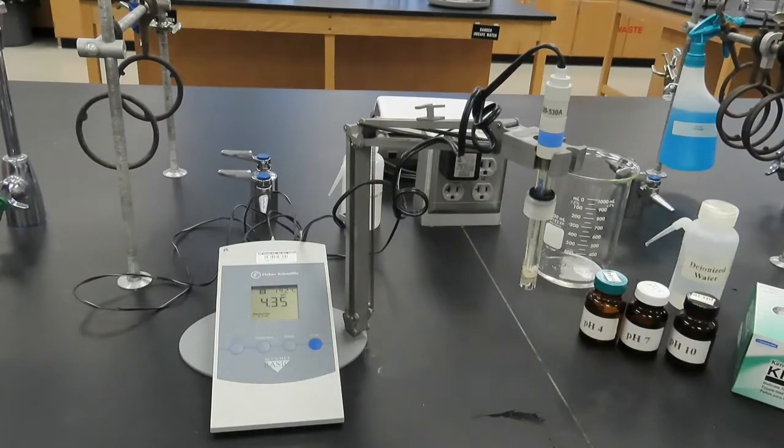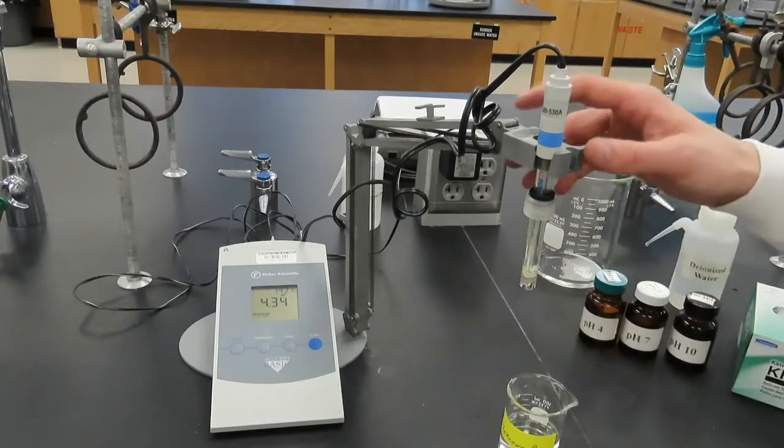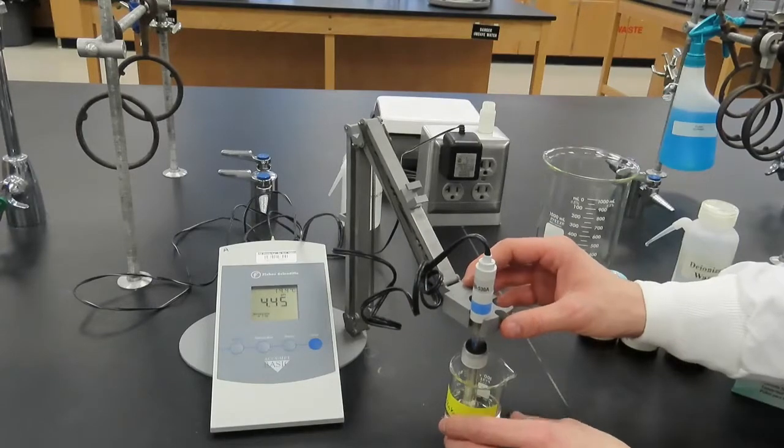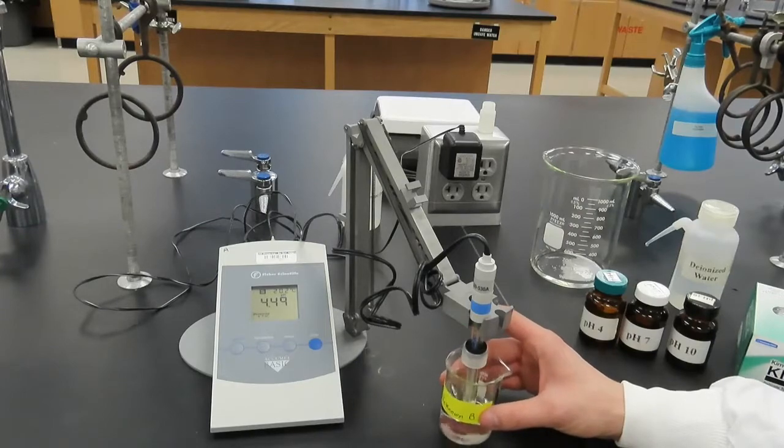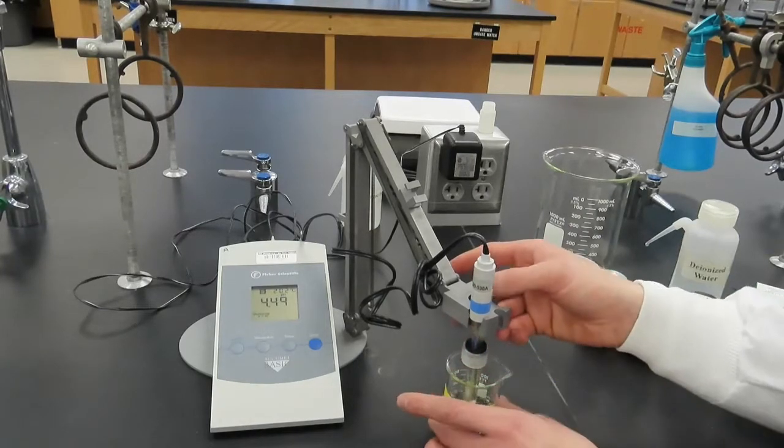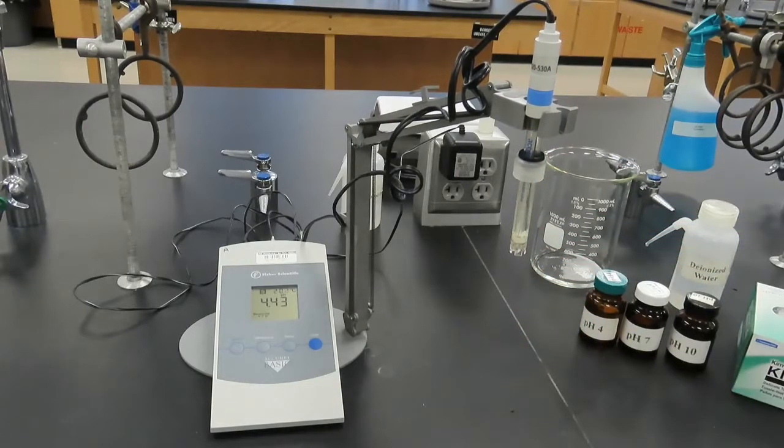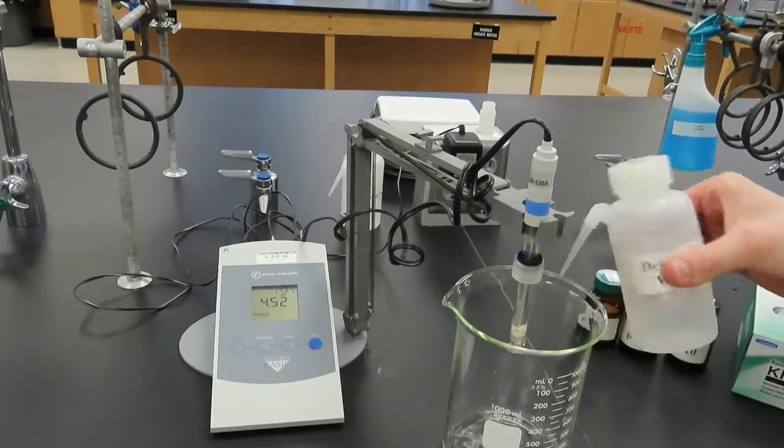We'll remove the electrode from the unknown B solution, rinse and dry it.